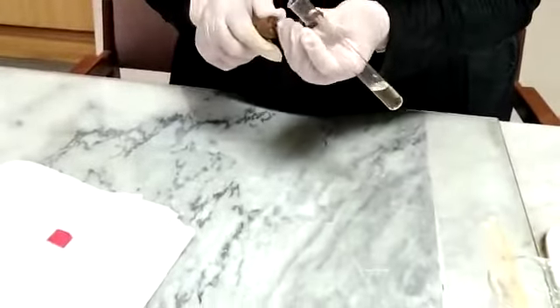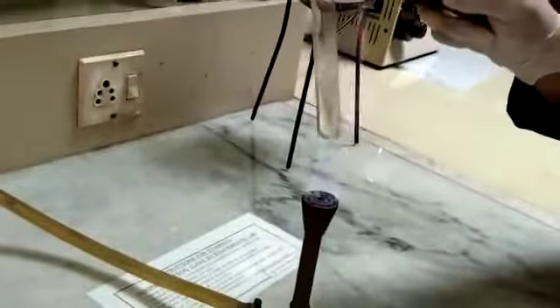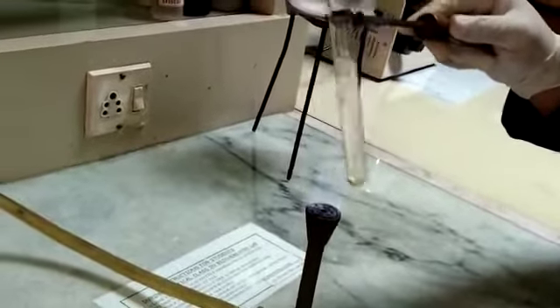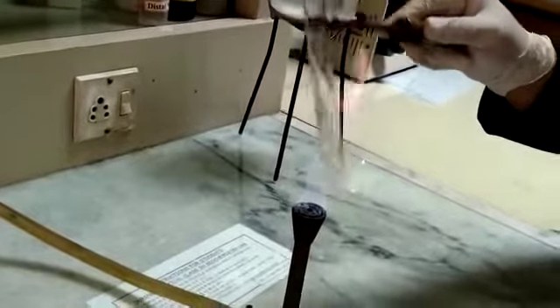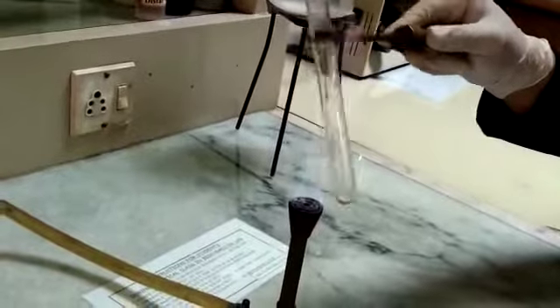We will observe for color change. The Seliwanoff's reagent in the presence of keto sugar will change the solution color to a cherry red color. Moving towards the Bunsen burner for heating — shaking the test tube over the flame back and forth will cause uniform heating of the solution. The color will appear in about 30 to 40 seconds.